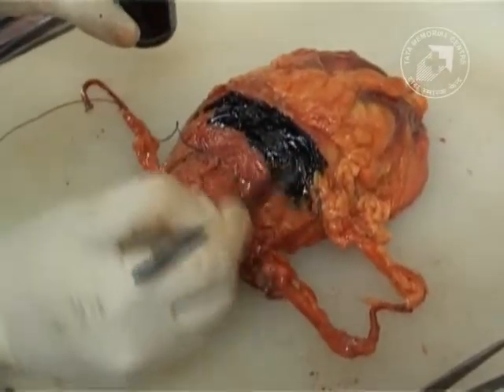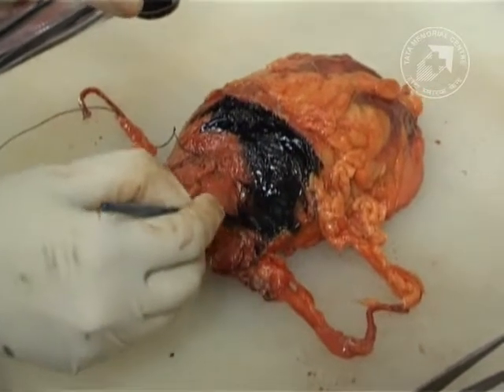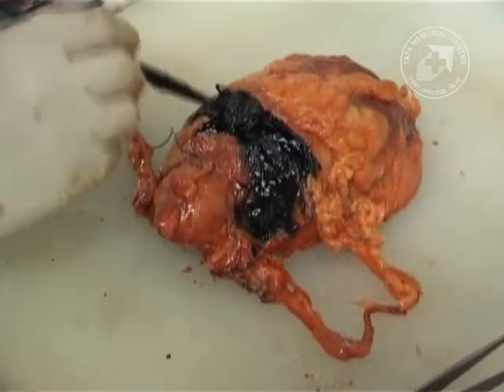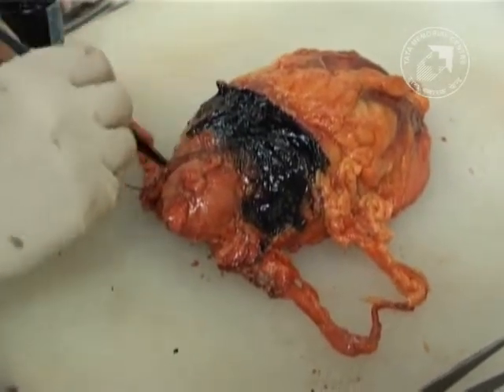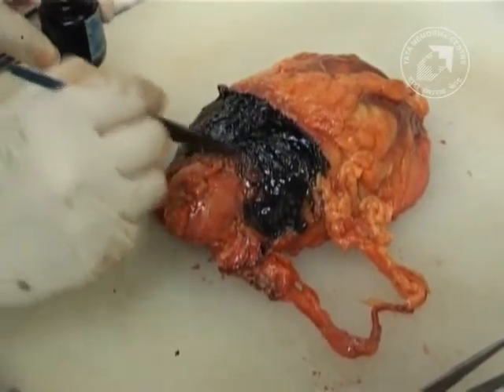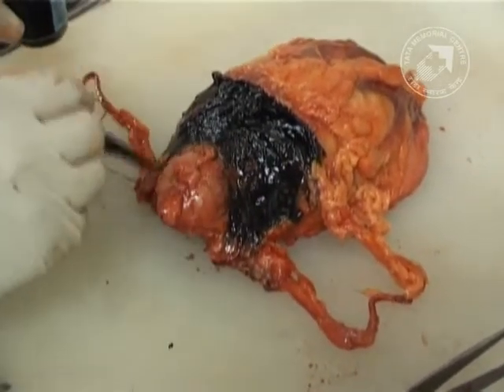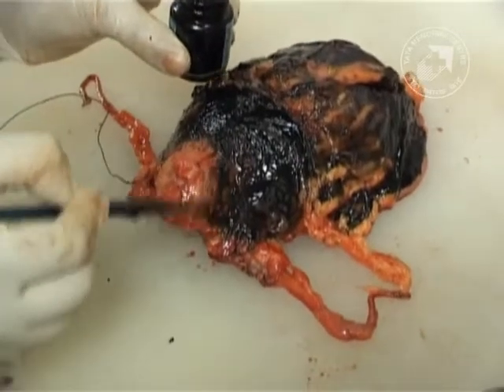We start by painting the anterior aspect using the black ink. Inking is required in microscopy to look at whether the tumor involves the ink or not.